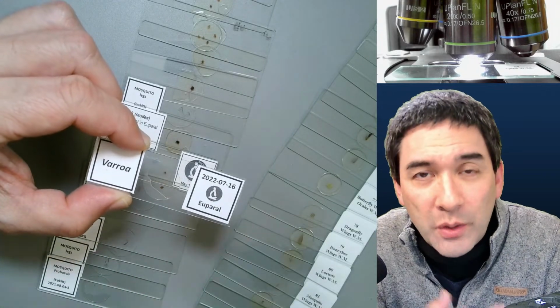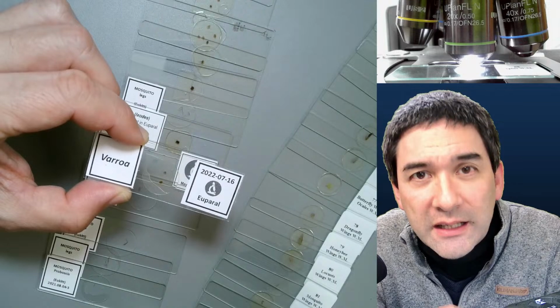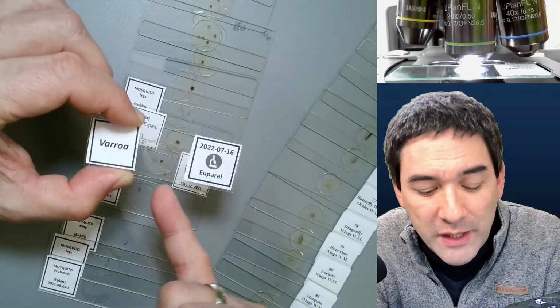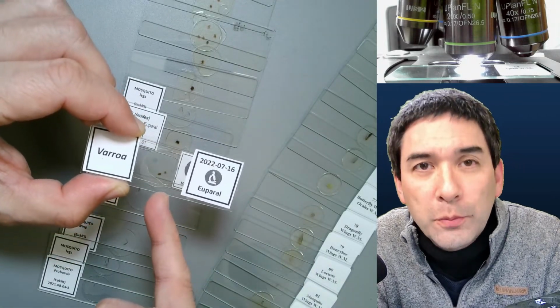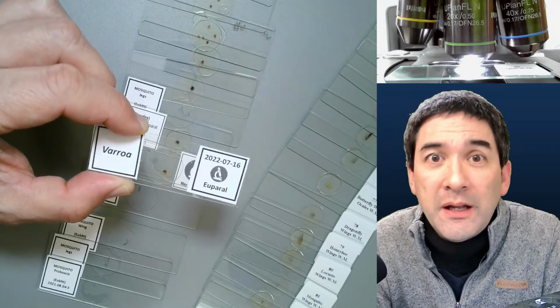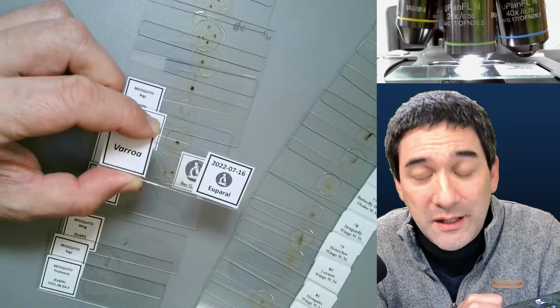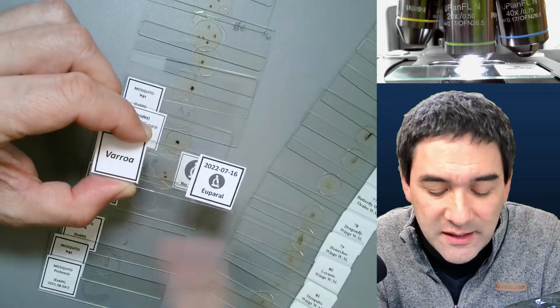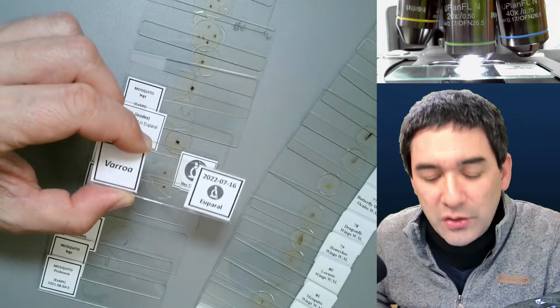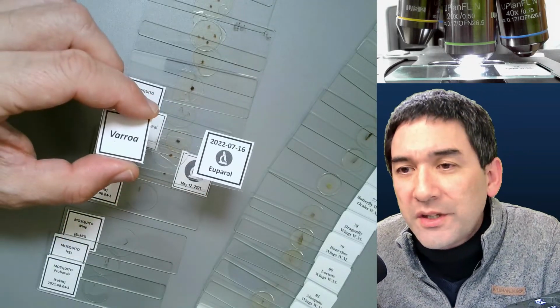You don't want that, so you remove the water and disinfect the insect, and then you can take it directly from the alcohol and transfer it into the Euparal mounting medium, and the Euparal is able to handle the alcohol. I'm saying this because not every mounting medium is able to do that. So in that sense, it's quite easy to prepare those specimens. Euparal is the mounting medium of choice for insects.